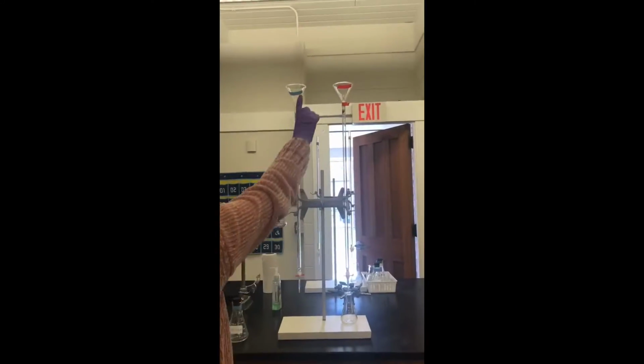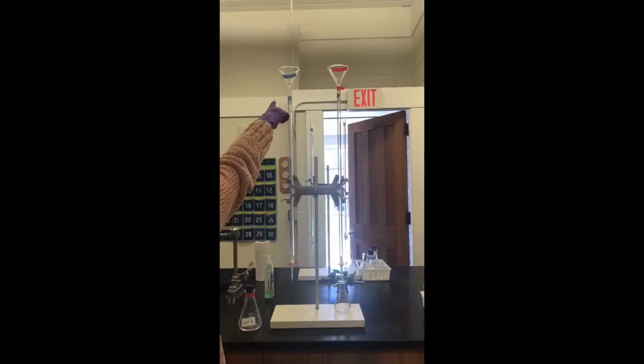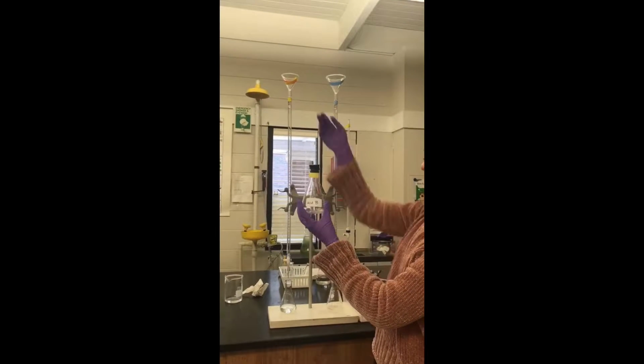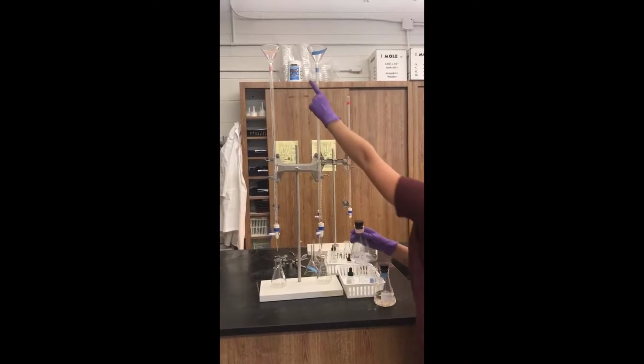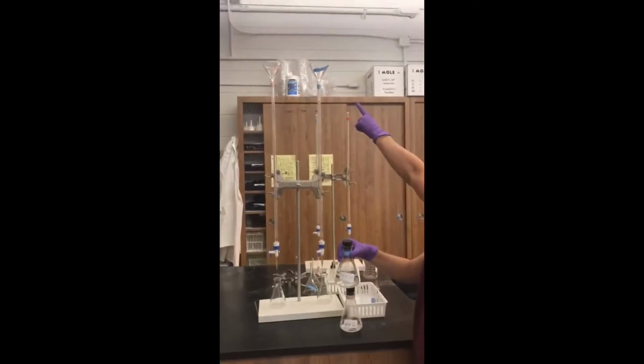Two clean burettes were put in the holder next to each other. The burette used for acid and the burette used for base was decided. This setup was constructed 3 times, once for each acid. The acid burettes were labeled with different colors corresponding to their acids. Acid A was labeled red, acid B yellow, and acid C pink. The base burette was always labeled blue.